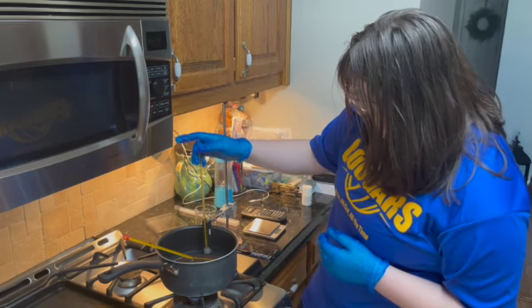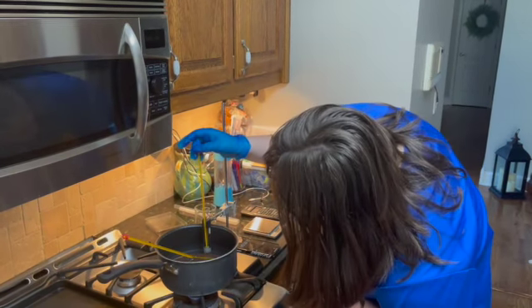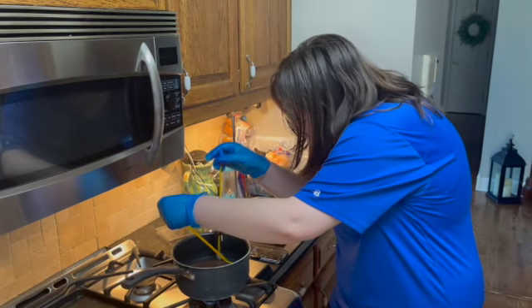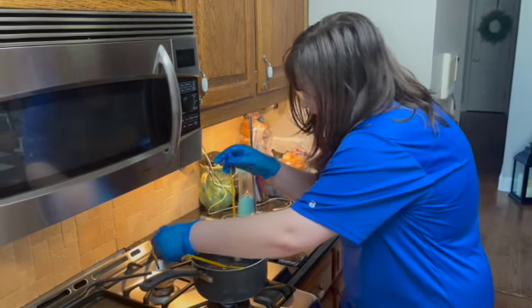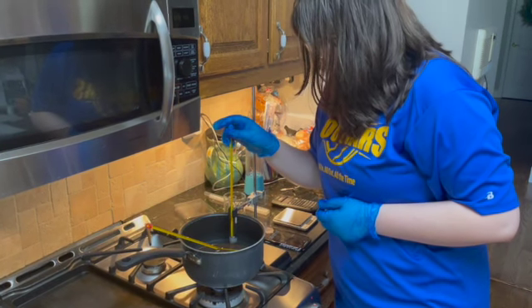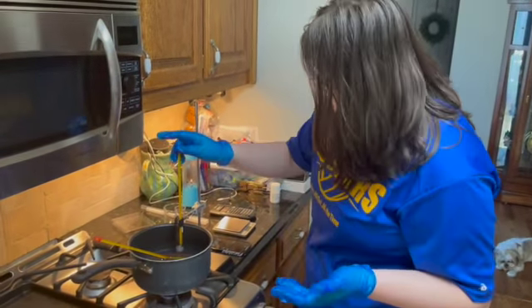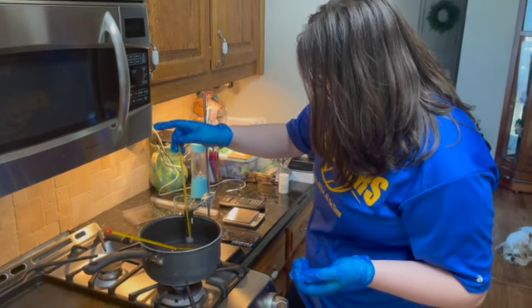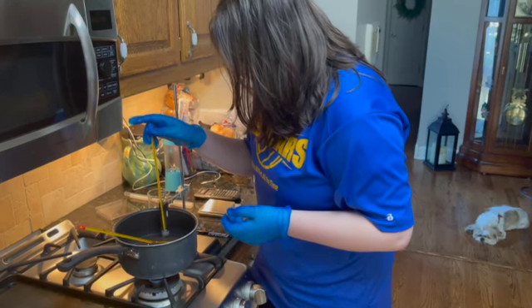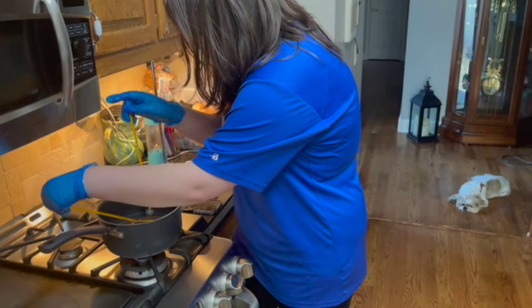But right now we are at the 5-minute mark, and our solvent's temperature is at around 47 degrees Celsius, and it is at 54 degrees Celsius in our hot bath right now. So we still got a little bit more. It seems like a lot of it at this point has melted, but we're waiting for it to melt completely. As we continue to go on, you can see a lot of it has melted. And we're still at 54 degrees Celsius for our hot bath.